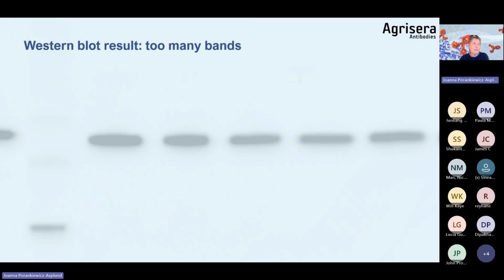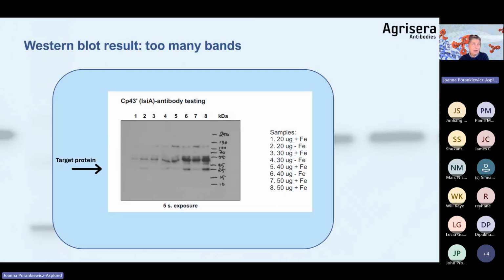And we have also another situation that we may have too many bands. In this case, target protein is detected, but as you see here, it's quite a lot of other things. And this result can still be optimized because for some protein antibody pairs, incubation of a primary antibody overnight may lead to increased background signal.